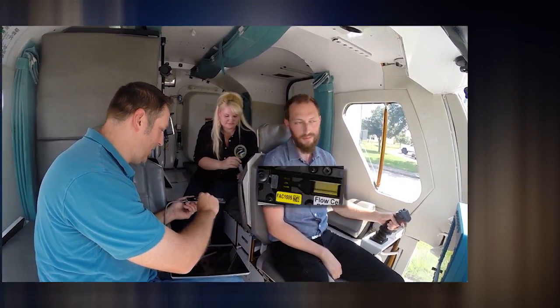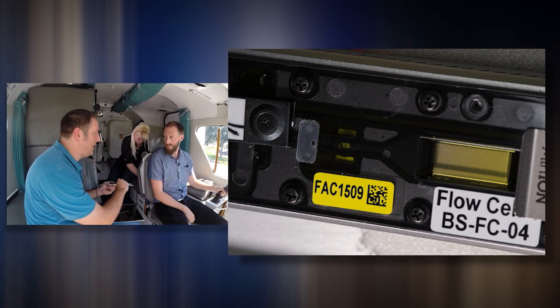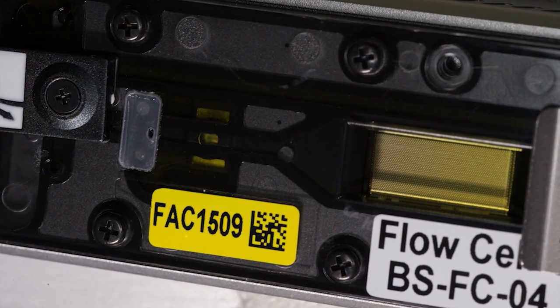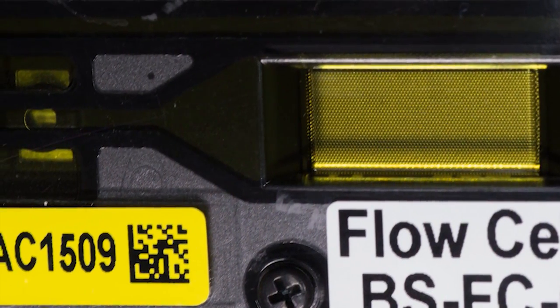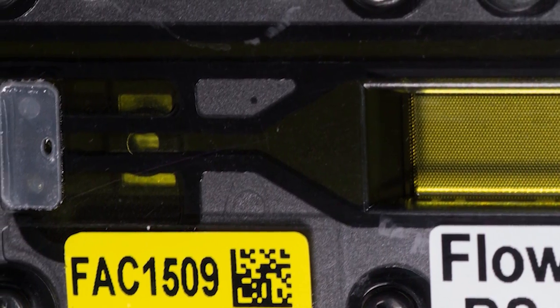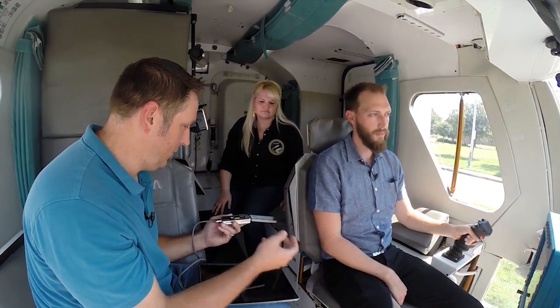In this little window here, there's a bunch of what are called nanopores. They're biological proteins that exist in normal cells, and they allow ions to flow through — they're just big enough to let a single strand of DNA actually pass through the pore. When there's nothing in the pore, you get a certain fixed current, and as DNA passes through it, the pore gets blocked and the current is reduced. It's that change in current that tells you what the sequence of DNA flowing through it is.